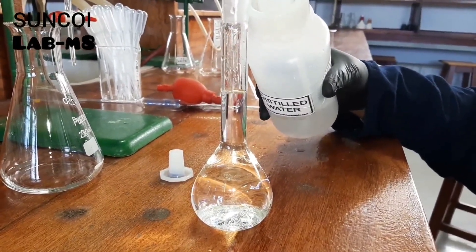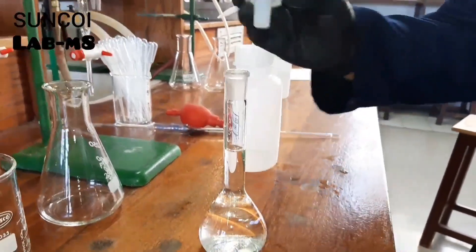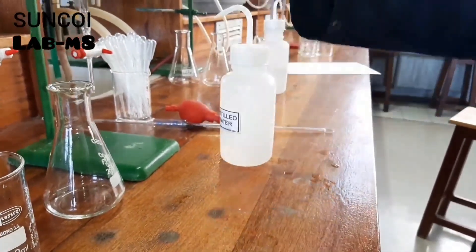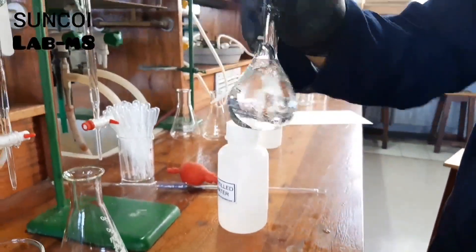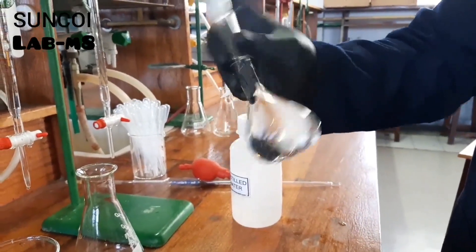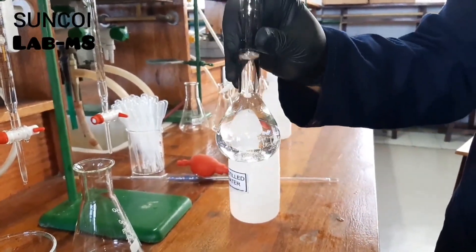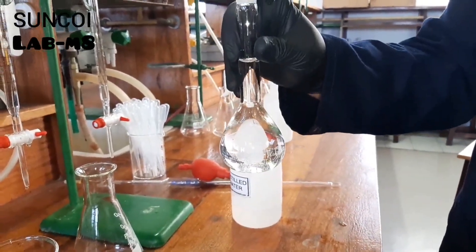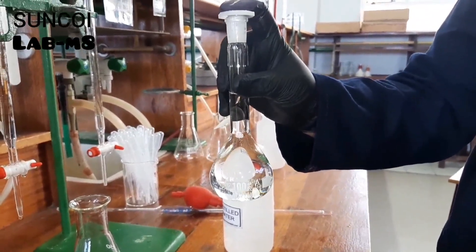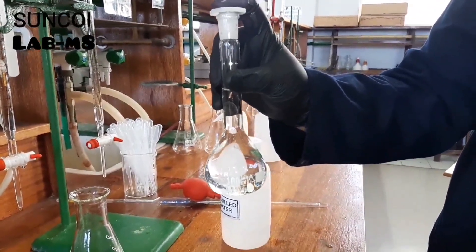When she reaches the mark, she can close it and mix — and there you have your standard solution. This is the solution you will need to do your titration.